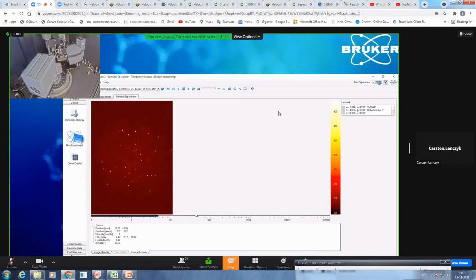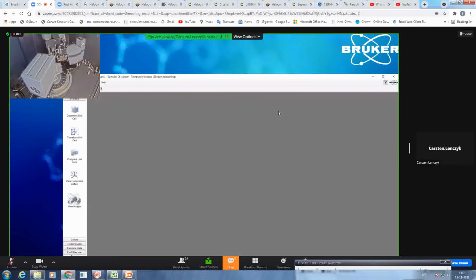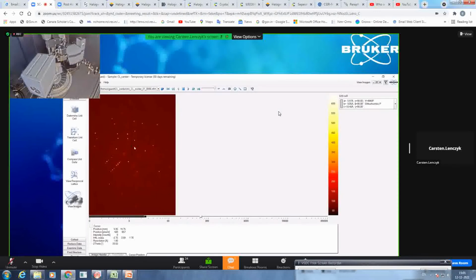To check them in more detail, you can also go to evaluate and view images. And here you can browse step by step through the images. You can use the resolution circle, which I would always do afterwards, or with some of the frames, because here you get an idea how well your crystal is diffracting and to which resolution you get signal. So here, even beyond 0.8, I would suggest you see down here that you will already get some signals.